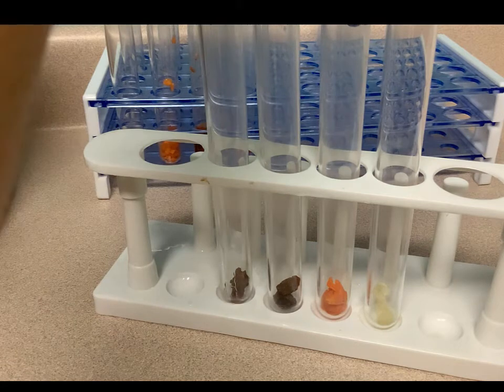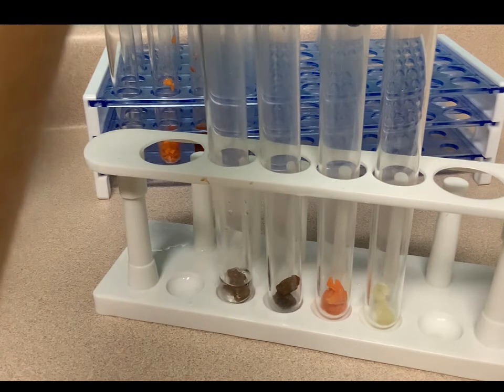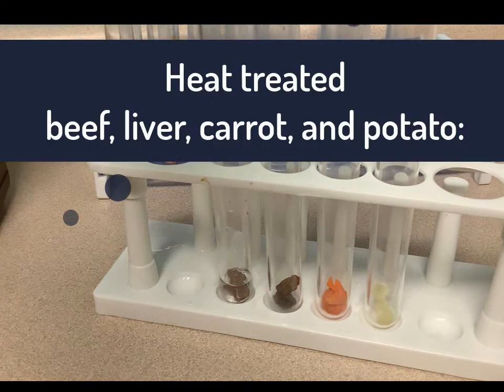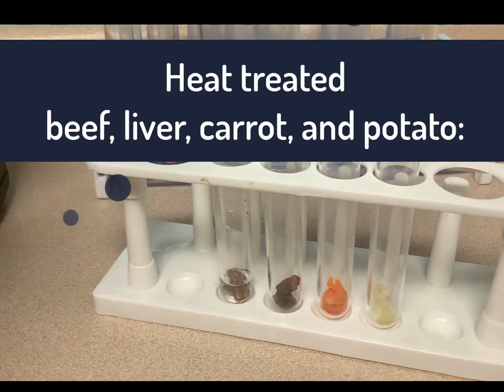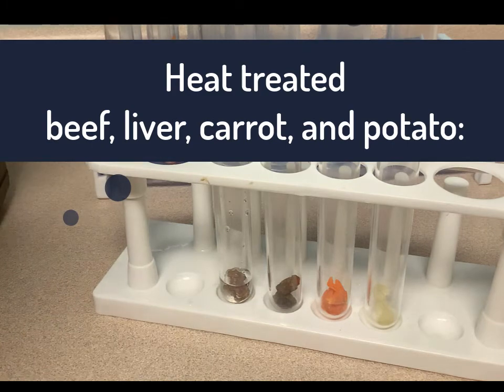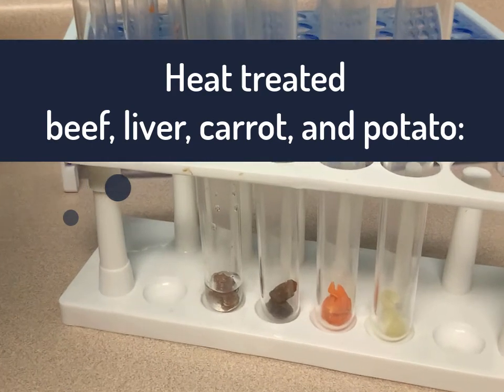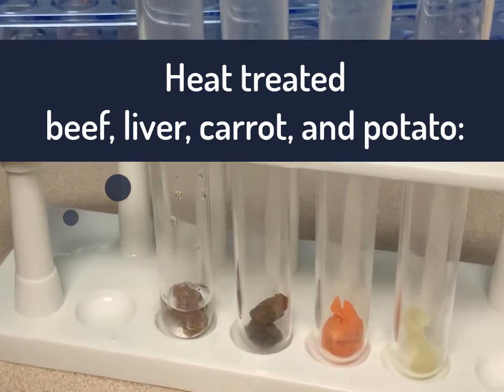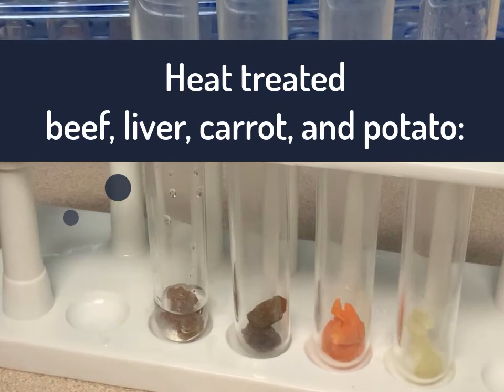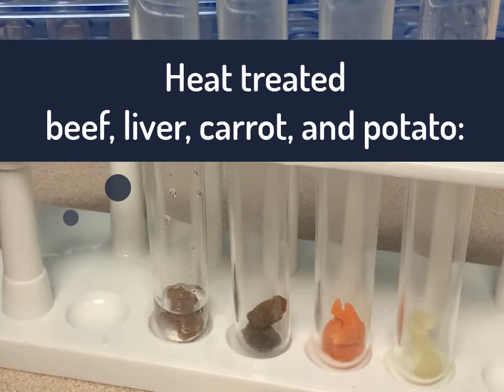And here we are going to add hydrogen peroxide to previously heat-treated test tubes. Let's see if microwaving them on high for a minute was enough to destroy catalase.